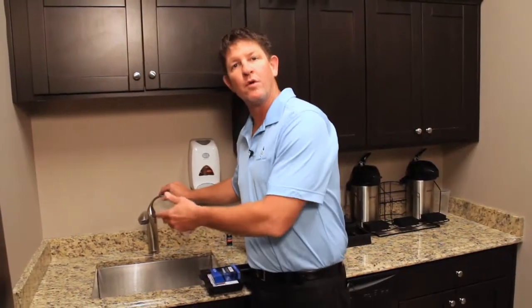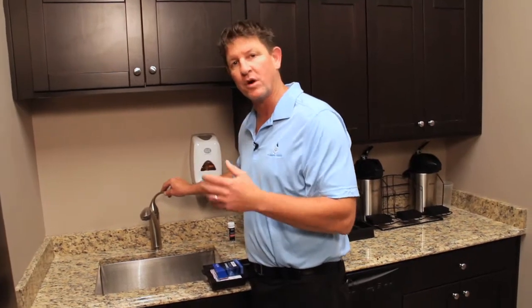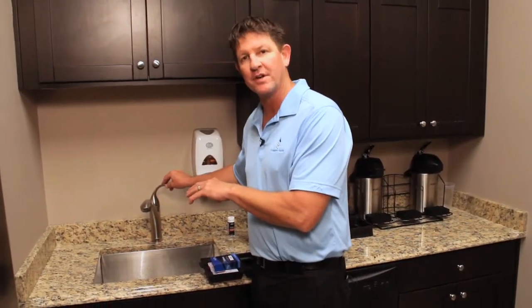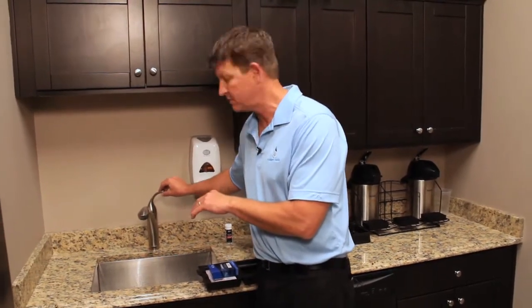What you want to do is run the water for about 1 to 2 minutes. We want to draw in fresh water off the street. If the water's been sitting stagnant in the plumbing system, you're going to get an inaccurate reading of how much chlorine or chloramine is actually in the water.